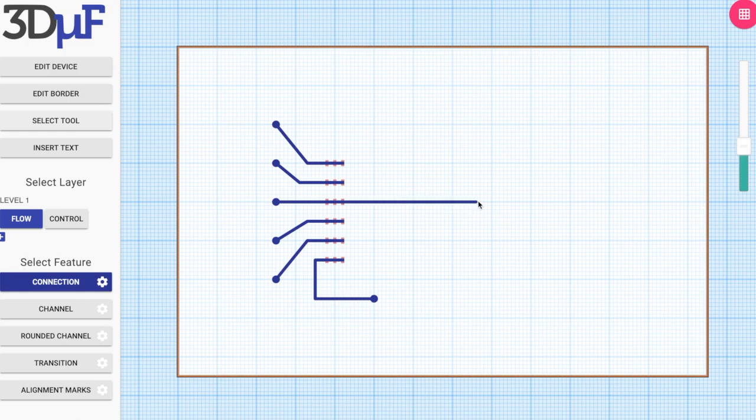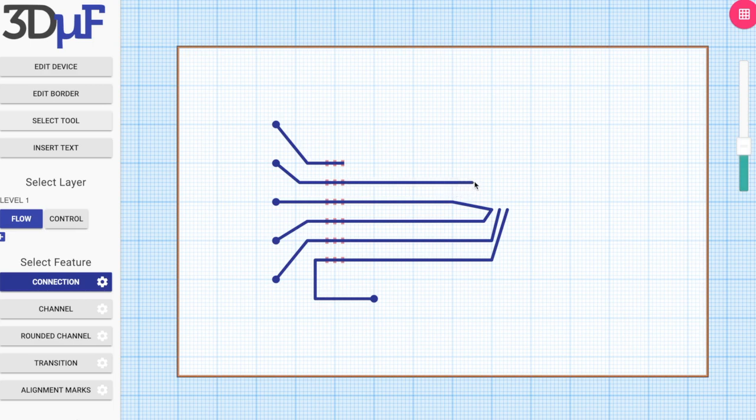So I'm going to create the rest of the connections which are necessary in the device. For these connections, I'm just making an approximately similar connection network as seen in the original paper. Obviously, future versions of 3DμF will have better tools for calculating the resistances and the delays in the fluid flow. But for now, in this version, we will just have simple placement of these connections.